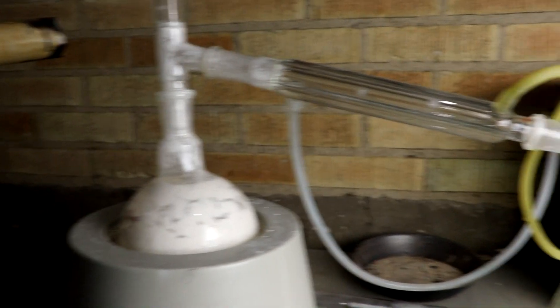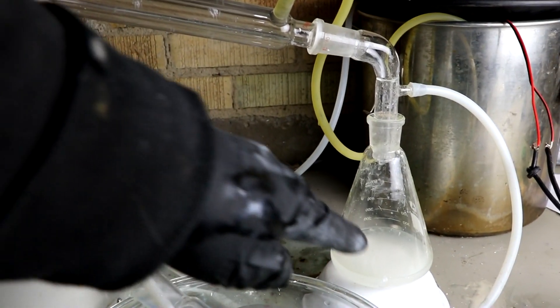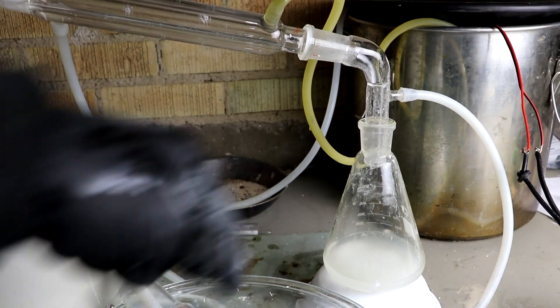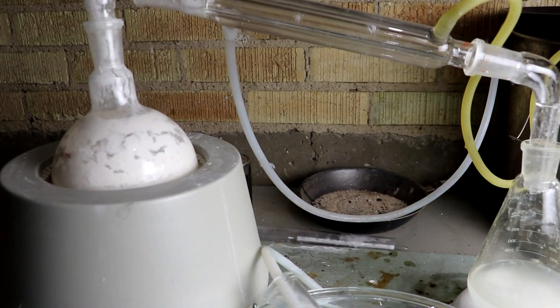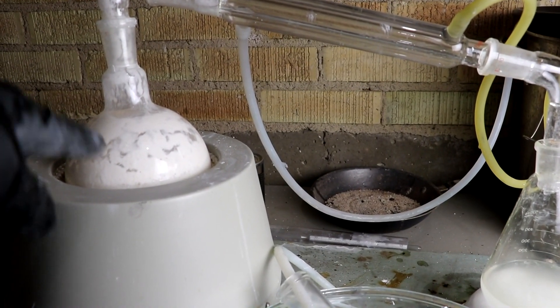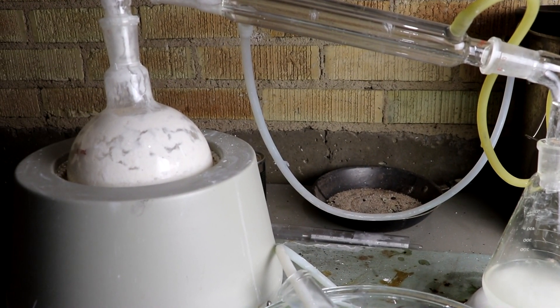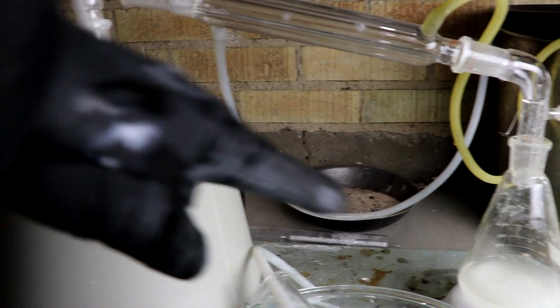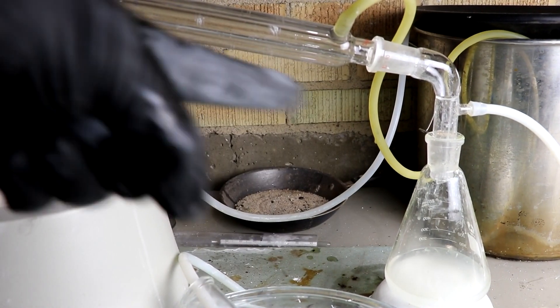So I actually had a little bit of a boil over. You can see my solution over here is a bit murky. So I think once this is done boiling out the ammonia, I'm gonna clean it out and put this stuff back in and re-distill it.